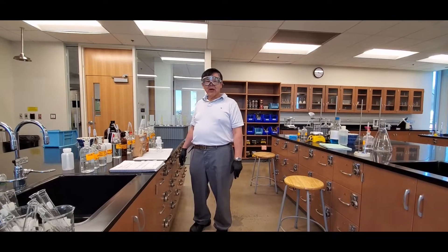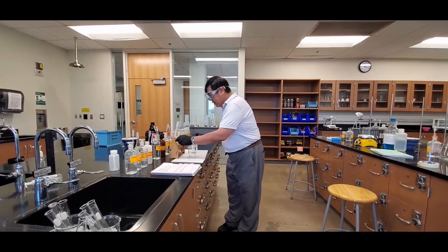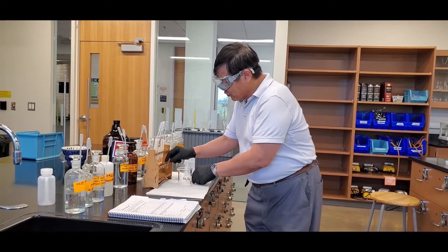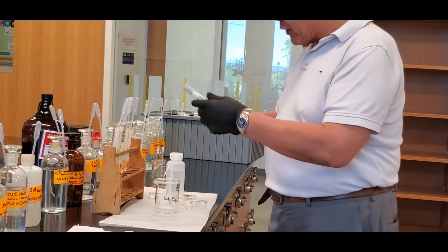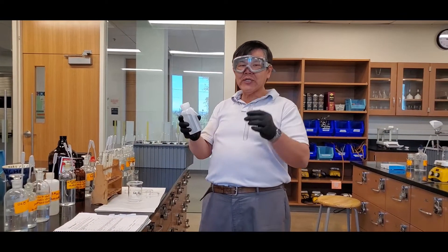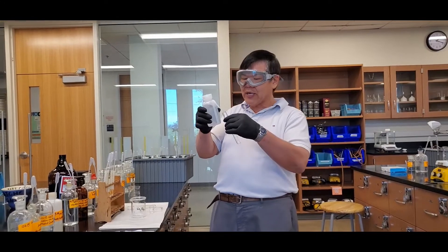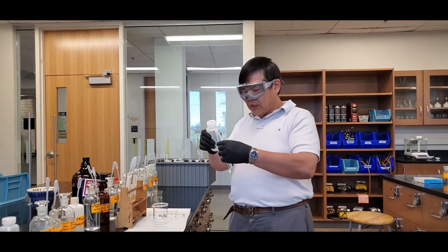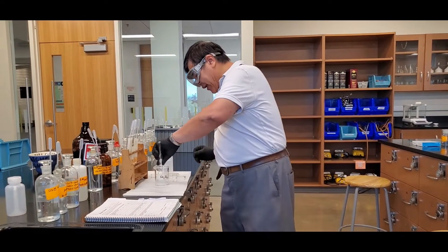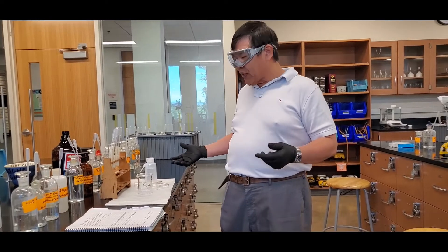After every test, pour your liquid into the waste container. Also empty the beaker. Then rinse between each test using distilled water — not tap water, because tap water causes false positives. Don't fill the test tube all the way up. Three small rinses are better than one gigantic one. Three rinses is sufficient — you don't need to dry the test tube after.